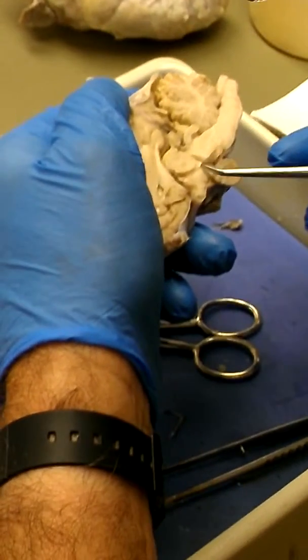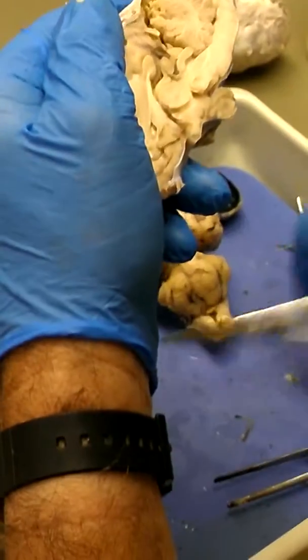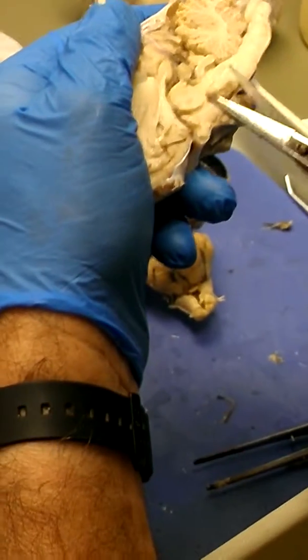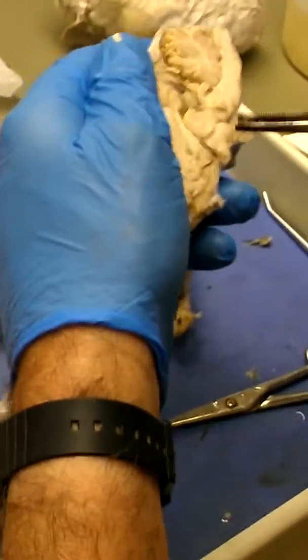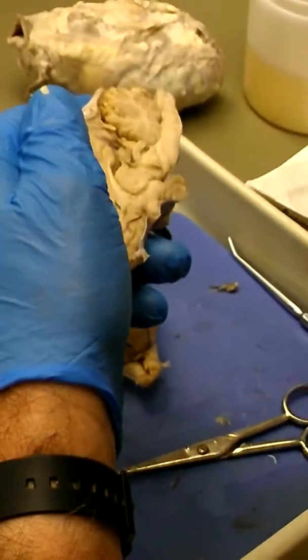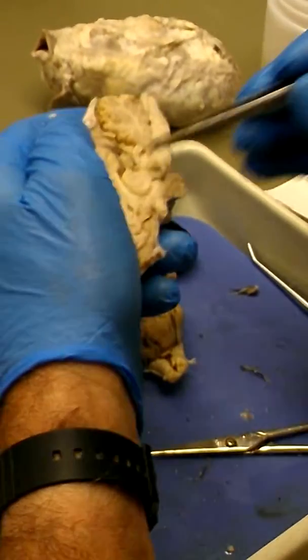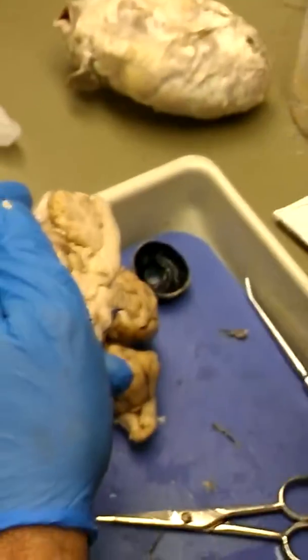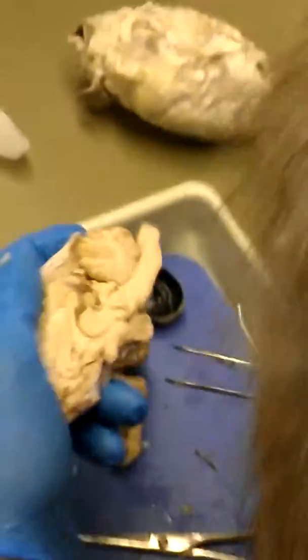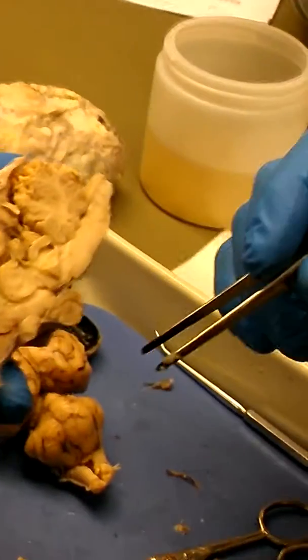Okay. And in fact, because of the way the cut was made, I can clear some stuff back and make it even clearer. Okay? So, I've got a big round structure right here. This brown structure right here is called the thalamus. Okay? Under the thalamus, this is the optic chiasm right here, right? Optic chiasm was right, remember that? Okay. I have a structure here, then I have the pituitary here.